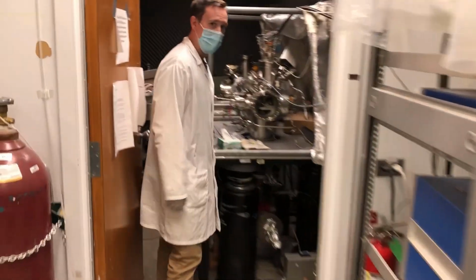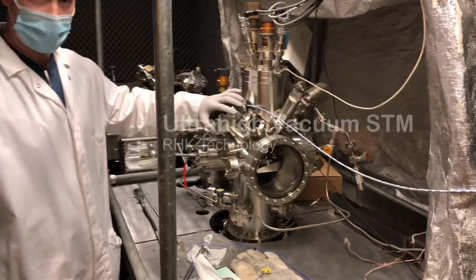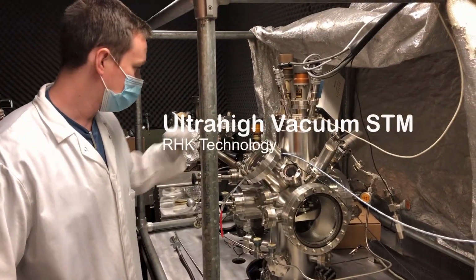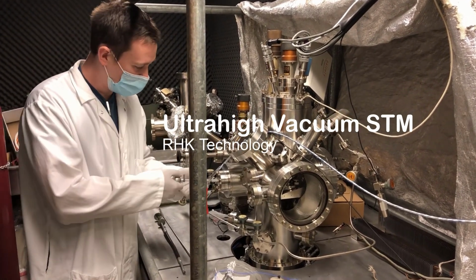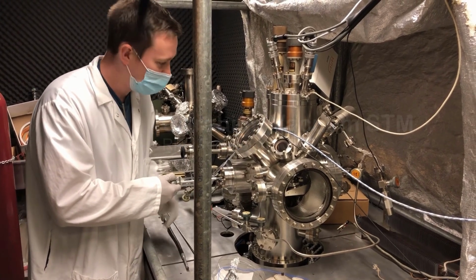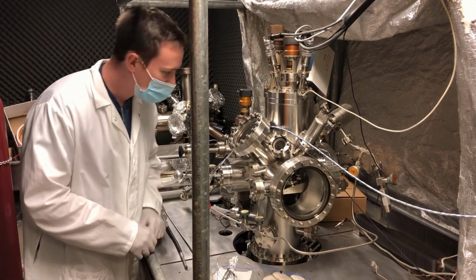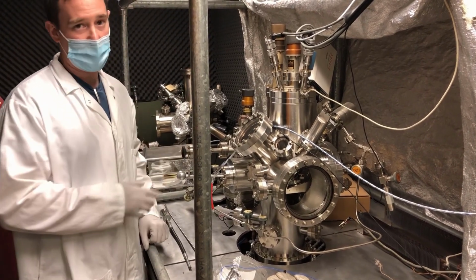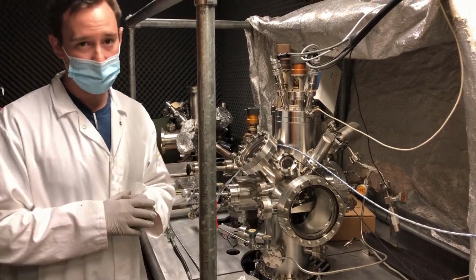Ultra-high vacuum scanning tunneling microscope with the same design, but now it's under, again, we call it UHV, ultra-high vacuum. And you can see here, in order to manipulate things, we need something called a Wobble Stick. And you can see it's on a vibration isolation unit. And I can move things in and out of this vacuum system. And because it's in vacuum, it's much cleaner than it would be in air because of adsorbates and moisture.